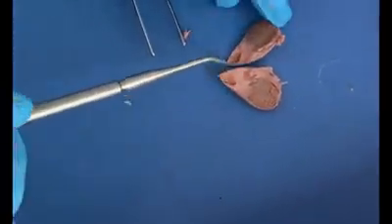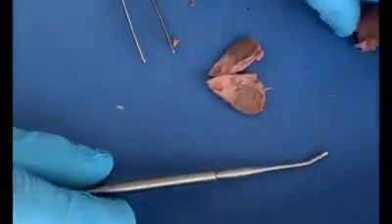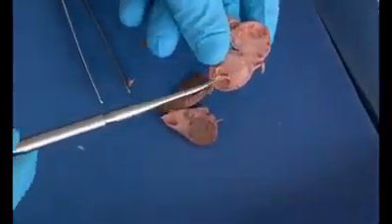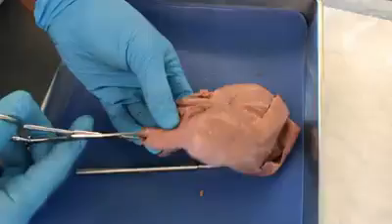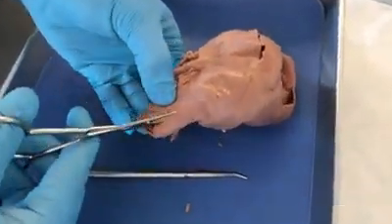And this is a tertiary follicle because it is visible by the naked eye. And I want to show you another pre-cut ovary. Here you can also observe tertiary follicles, and here are some smaller follicles. So now I'm going to cut into the cervix.